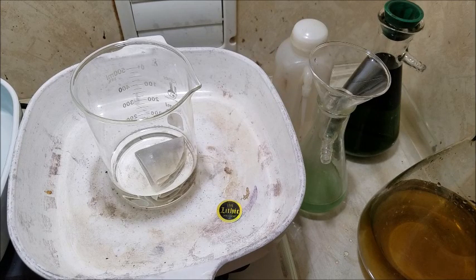Fear at this point would be if we still have some sort of iron trapped, and colloidal gold trapped into something, you know. But I can see the color starting to tint, and then I look at the camera screen and it's bright as can be, so let's see if it gets more obvious.